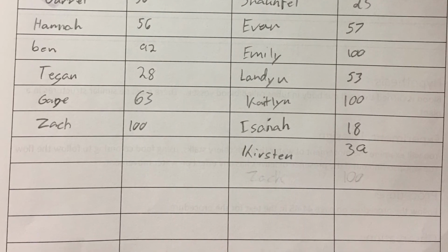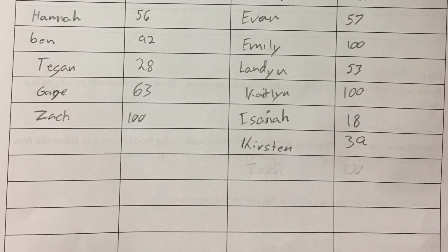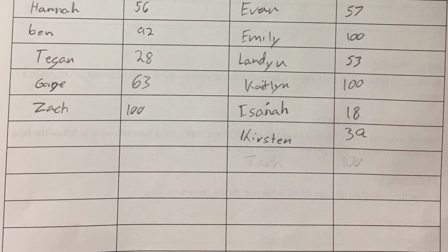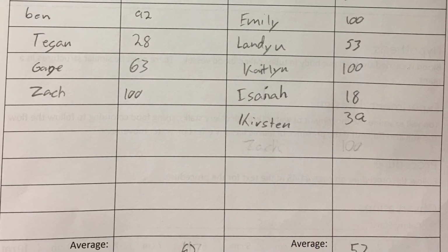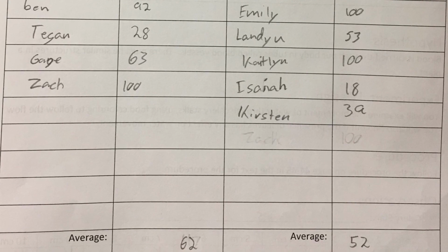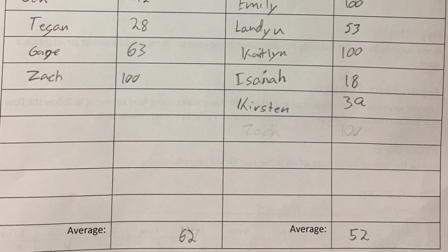That's the experiment that we did in a nutshell version so you could see it. Using the information from the data table, you should now be able to answer questions 1, 2, 3, and 4 in your experiment. Alright, I'm looking forward to seeing your results.